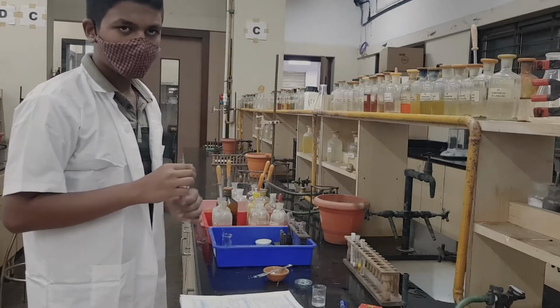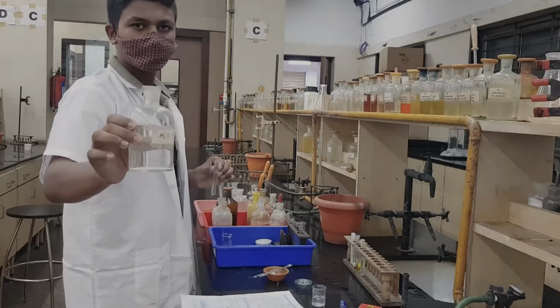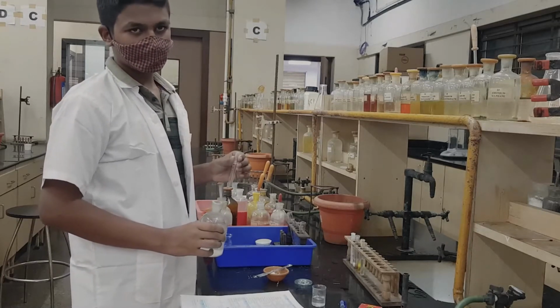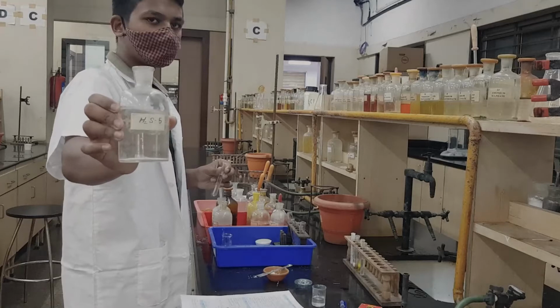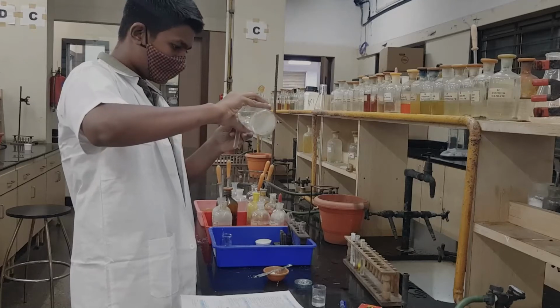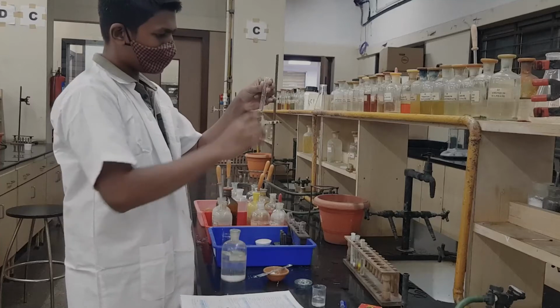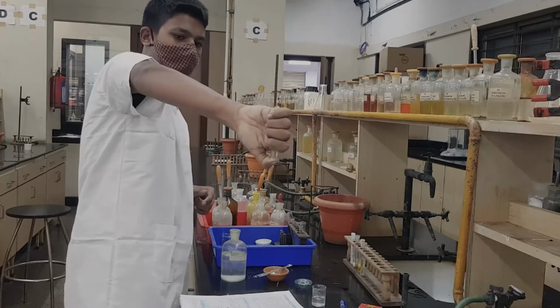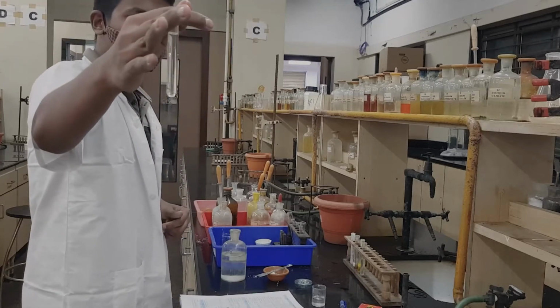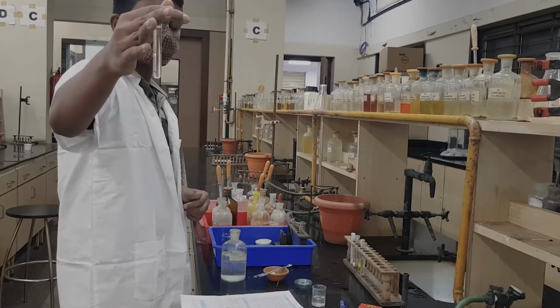Now, since group 3 is absent, we go to the next step, step 4. You take OS, you take ammonium chloride in equal quantity, you add ammonium hydroxide, and then you add H2S to the same solution. The expected answer is either a white or black PPT. Let us see what is happening. Just invert the test tube so that there is a uniform reaction. What you observe is neither white nor black, but still a clear solution. That means group 4 is absent.